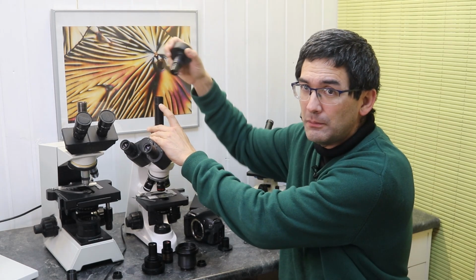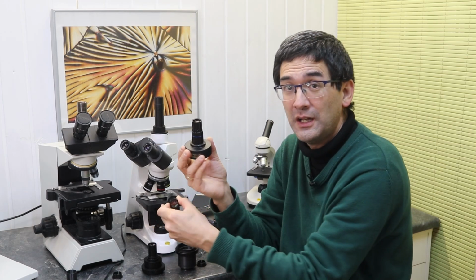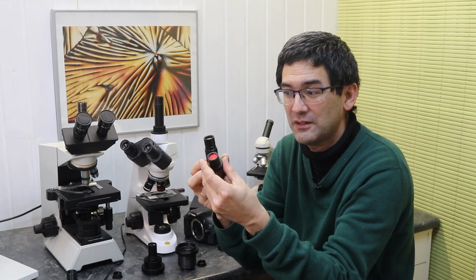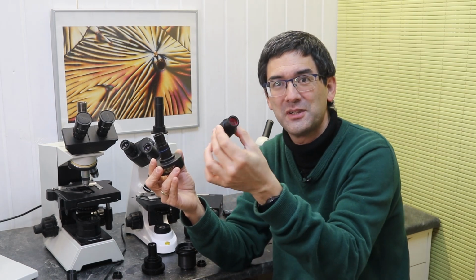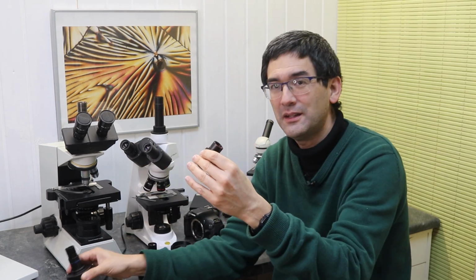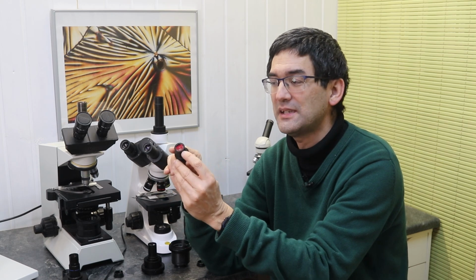Now, there are some other microscope cameras, like the one that I have over here, that do not have optics, and you see it's significantly smaller. It's just got the size of an eyepiece, and it does not have optics. But if you look carefully here, and you might not be able to see this now, the sensor is actually quite far in the front.